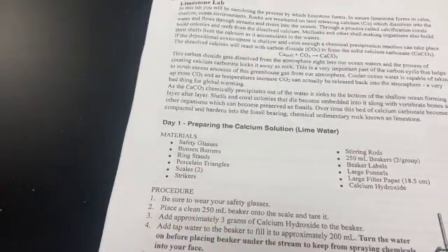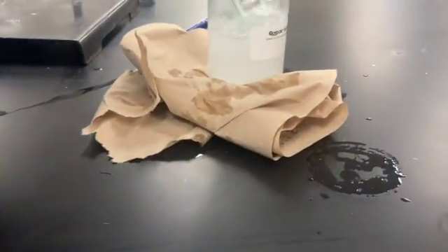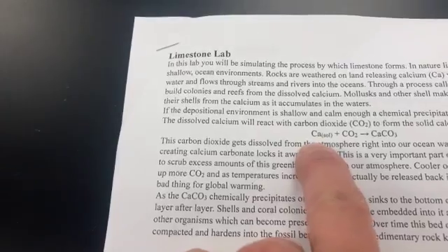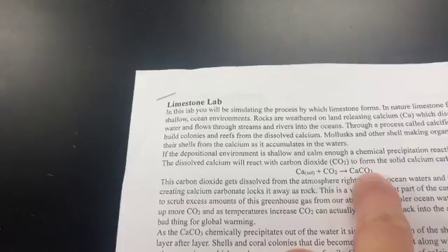So what I've got right now, I'll take you for a trip. The students have been bubbling into this. Let me take a look at what you got. Look at how white that's turning. It's turning very, very white. Got another one over here. The air that we're blowing out into it is making it turn quite white, and that is going to be the calcium carbonate that we're producing. There are 3 elements involved: calcium, carbon, and oxygen that combine to create CaCO3.